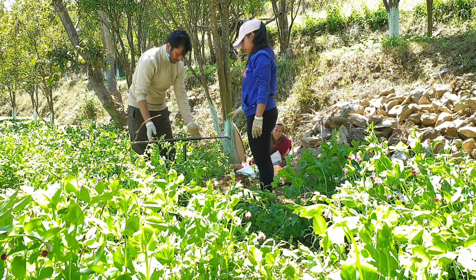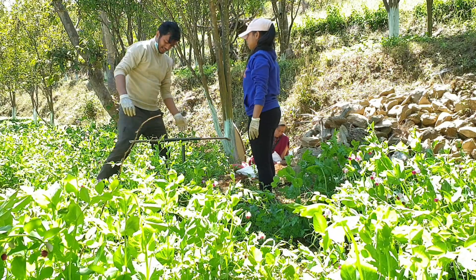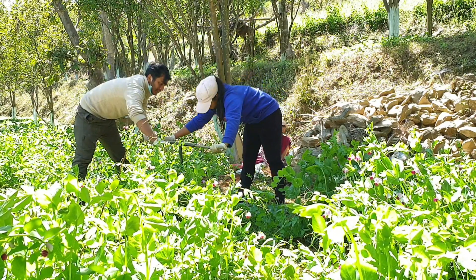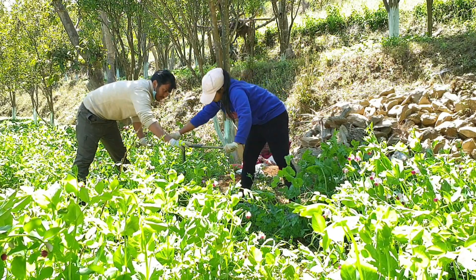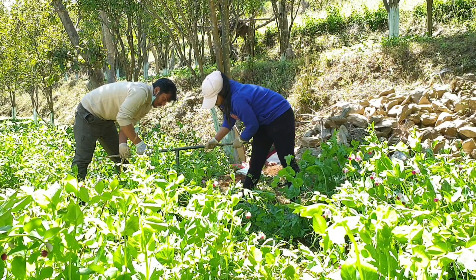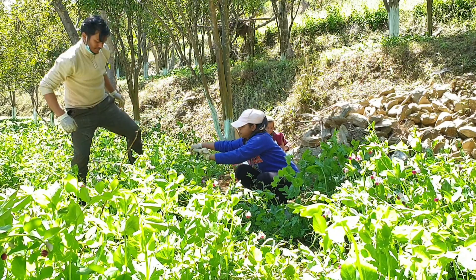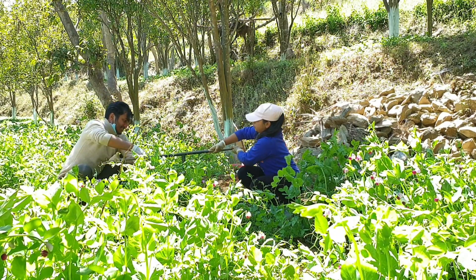The hardest part of soil sampling is inserting the auger to 3 feet depth — it's really difficult. Sometimes you encounter a rock or other obstacle that prevents the auger from going to 3 feet. If that happens, remove the auger and try a nearby spot to reach the 3-foot depth.